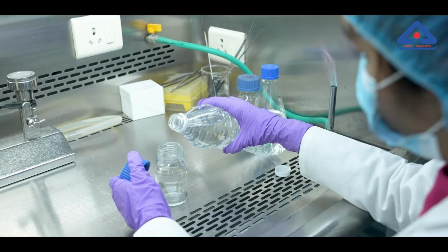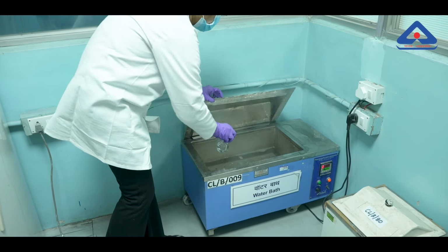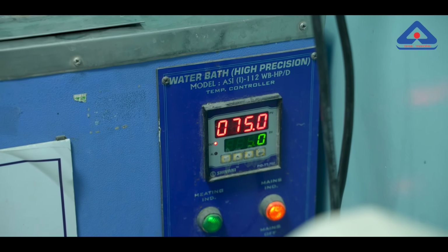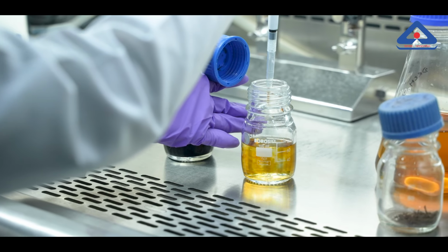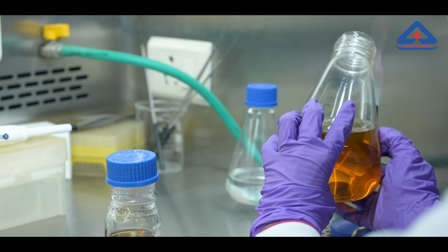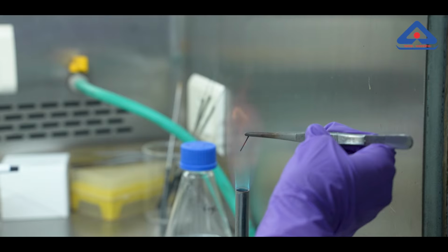Here's how it works. A 50 milliliter water sample is heat treated to eliminate non-spore forming bacteria. The treated sample is then added to 50 milliliters of double-strength DRCM. 2 milliliters of a mixed solution of ferric citrate and sodium sulfite in equal amounts is added to the inoculated sample.